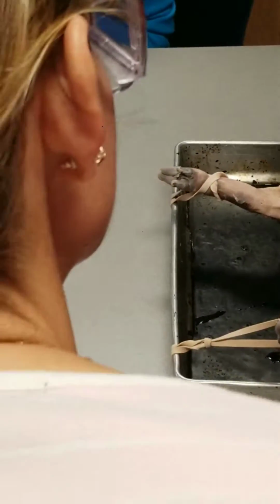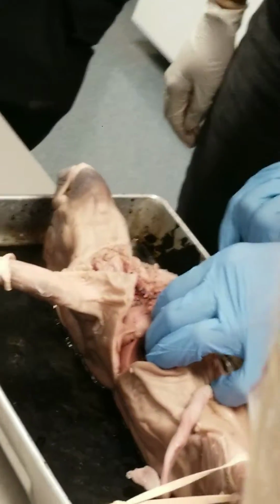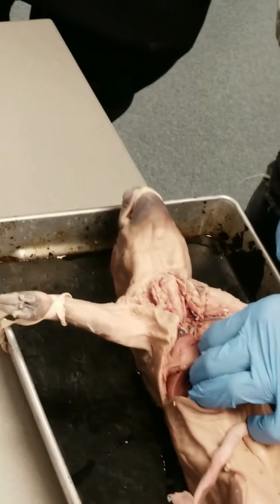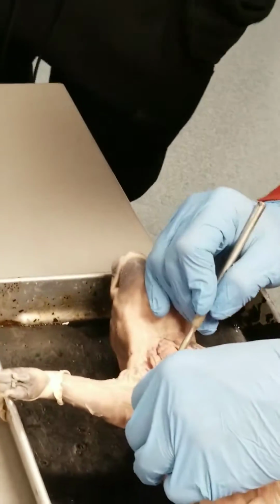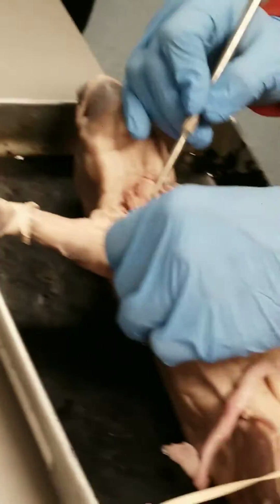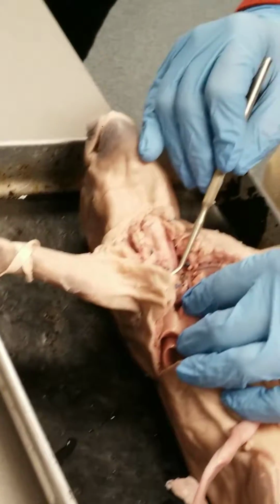And then the second branch off the arch of the aorta back here, it might be a little tougher to see if you're not close, is the left subclavian artery. That's the left subclavian artery. Now, if I have a little more time, I will work on trying to clarify the subclavian arteries, both of them.